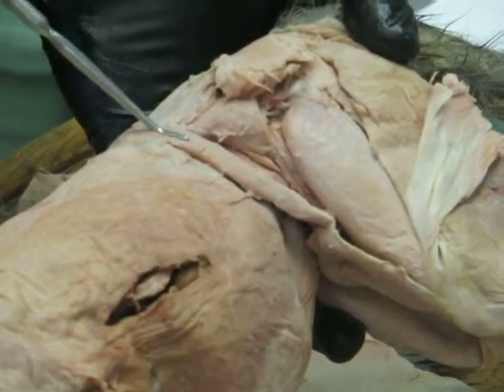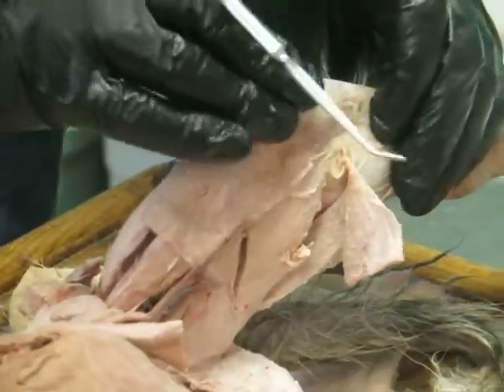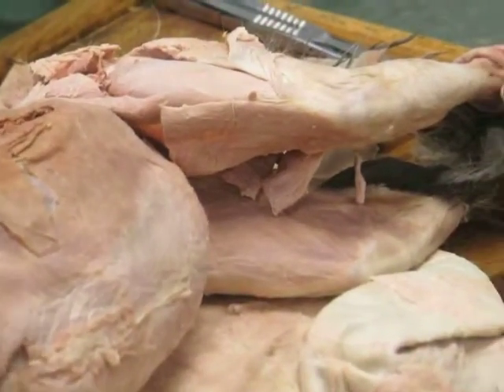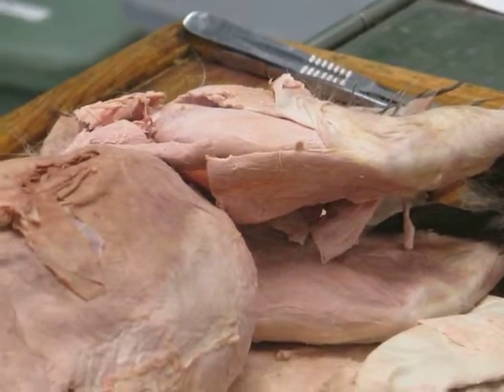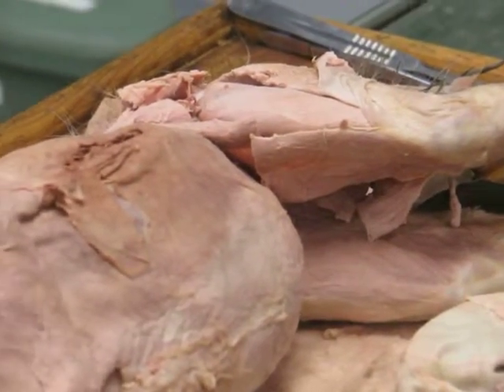Okay. If we flip tensor fascia latae out of the way, there's another muscle in the cat that you see running along, coming really from pretty far up on the ilium, running down like this, and inserting down into this fascia over the front of the knee. Okay, and this muscle would be, I know most of you guys have rabbits, but sartorius. That's the sartorius. And sartor means tailor in Latin. Like, have you ever heard of someone in sartorial splendor?